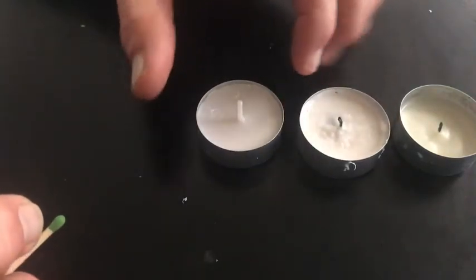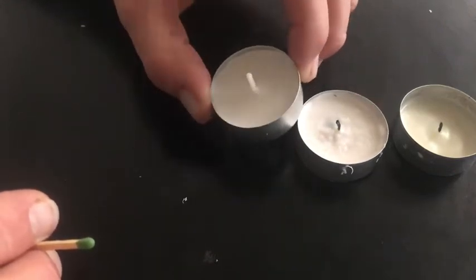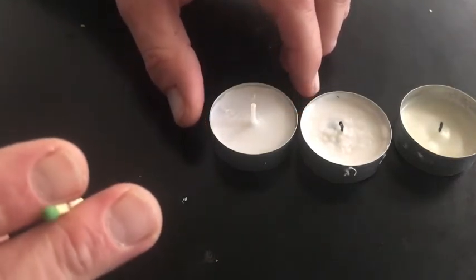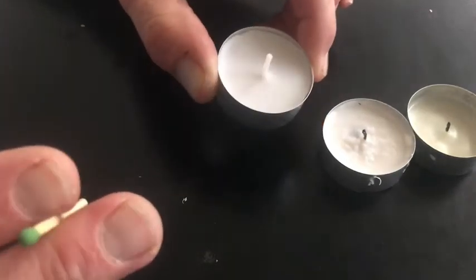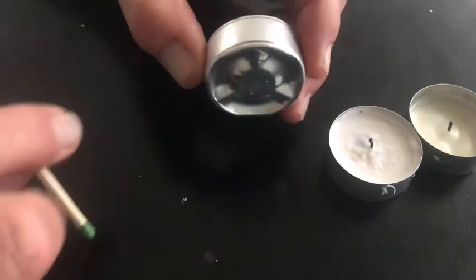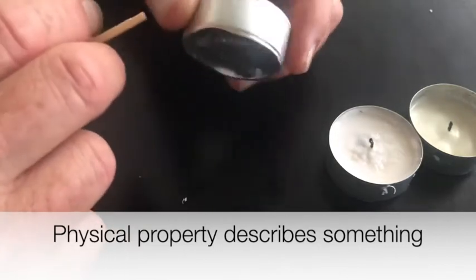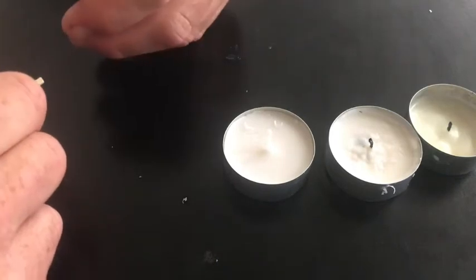So this is our candle, and one of the things you're supposed to do is make observations of the candle and then describe it in different ways. So one way to describe it is its physical properties, like what it looks like. So we can come up with several descriptions. One way to know what description is how is the wax different than this container, and the more differences you come up with, the more properties you end up with.